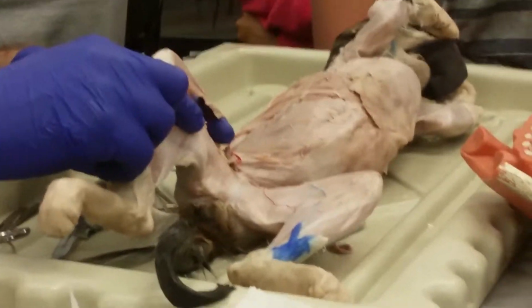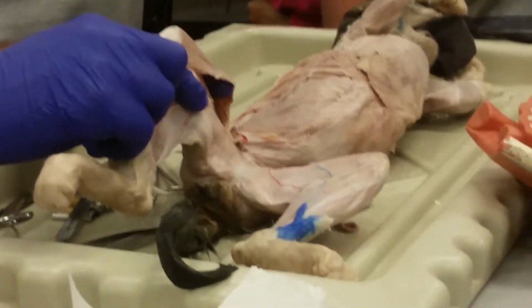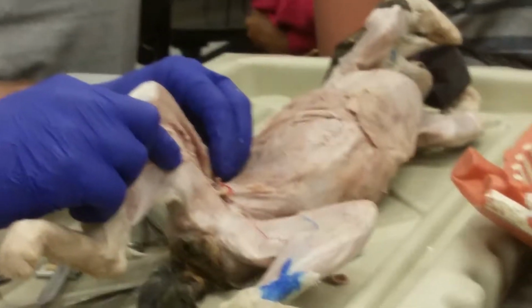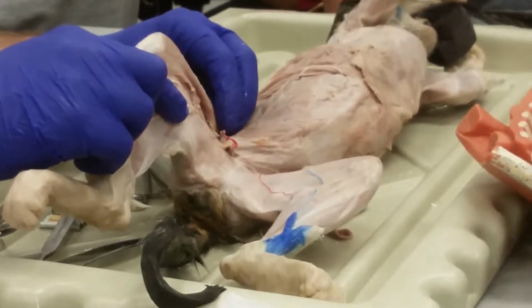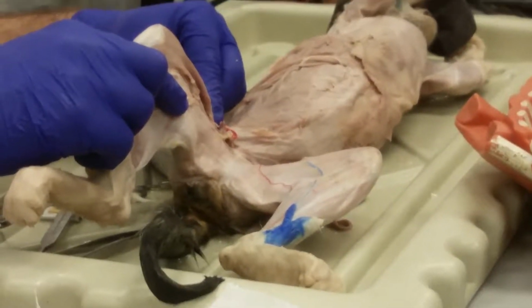All right, so let's think about what it's going to do on the hip joint. It's pulling on the hip joint from the front. What will happen to the hip when you pull on it from the front? You will flex it, right? It's like trying to dribble a soccer ball with your knees. You'll flex it, okay?